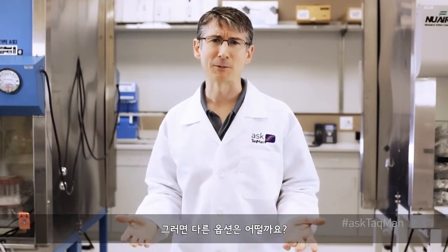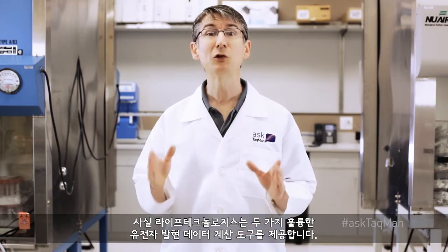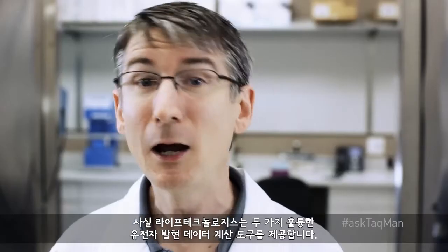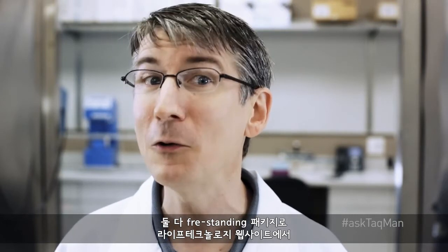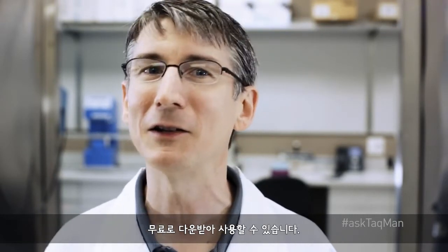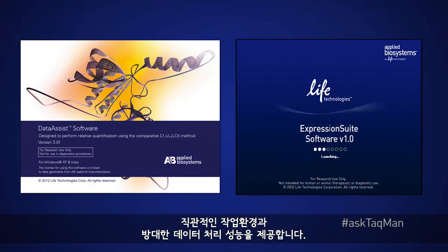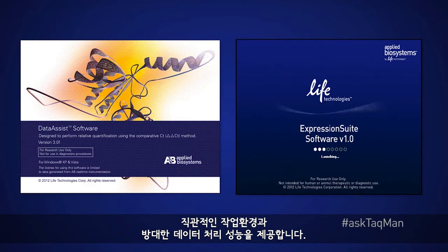But what about other options? Well, in fact, Life Technologies offers two other exceptional tools for calculating gene expression data. Both are free-standing packages that can be downloaded and used at no charge from the Life Technologies website.